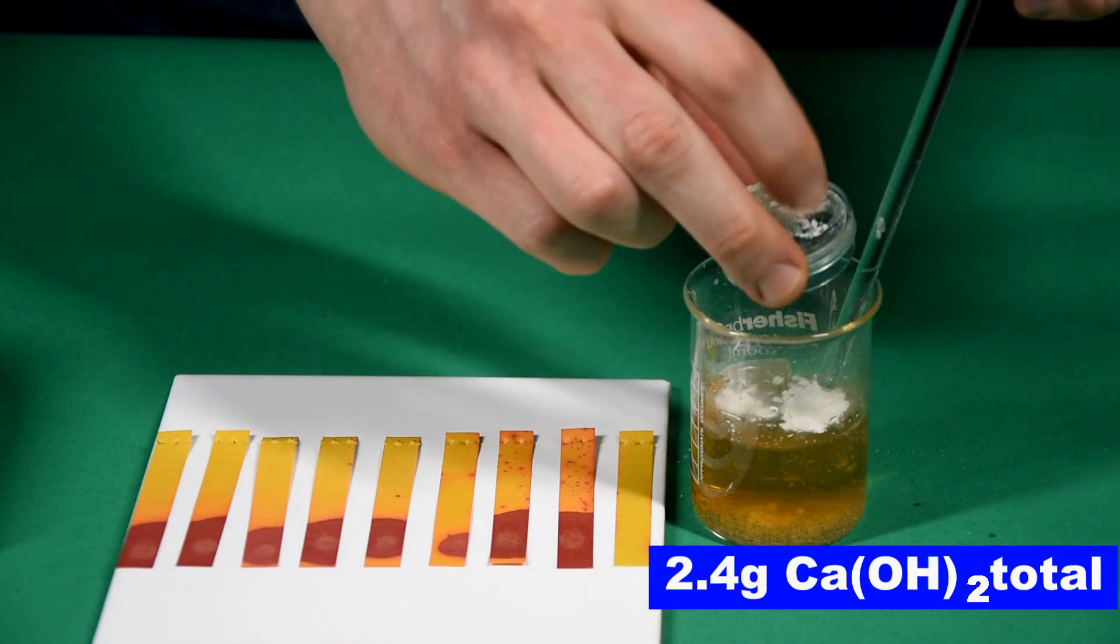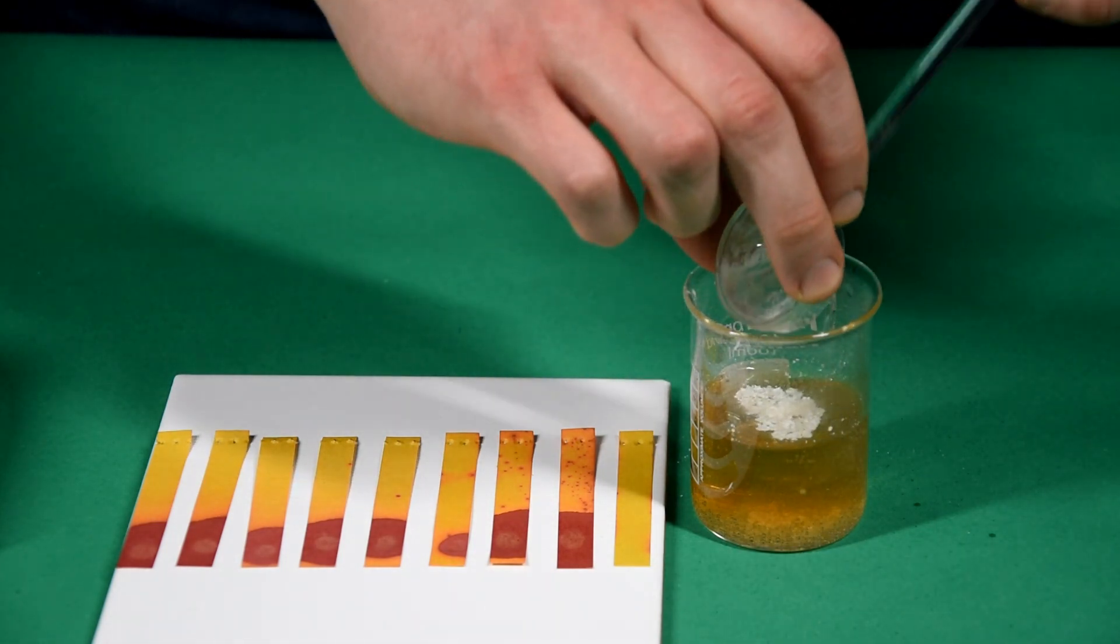And finally, 2.4 grams and the last of our universal indicator papers.